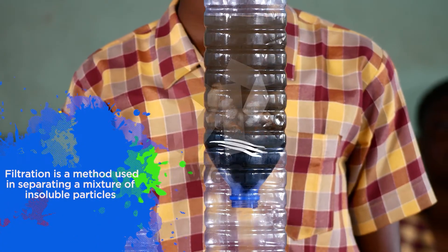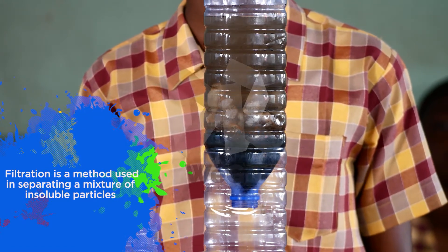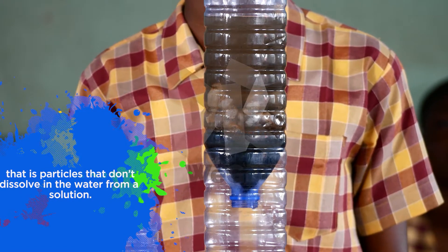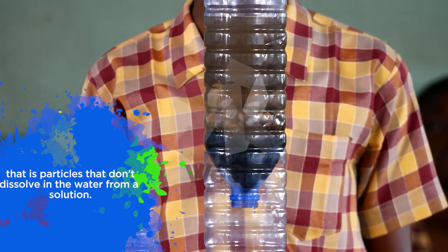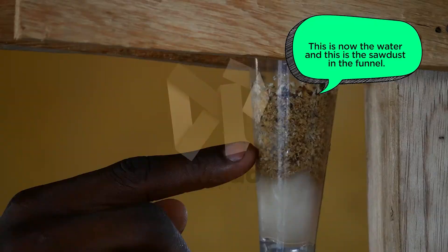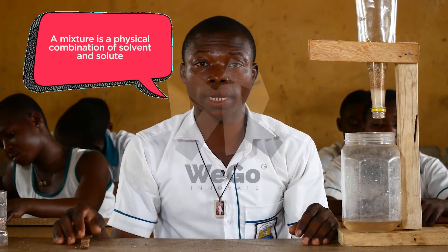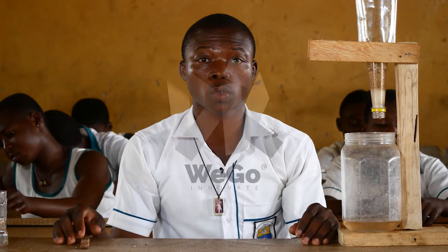This shows that I have successfully separated the mixture of water and sawdust by the method of filtration. Filtration is a method of separating a mixture of insoluble particles — that is, particles that don't dissolve in water — from a solution. This is now the water, and this is the sawdust in the funnel.